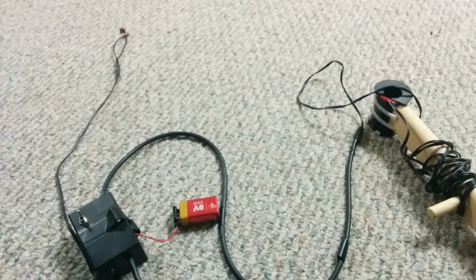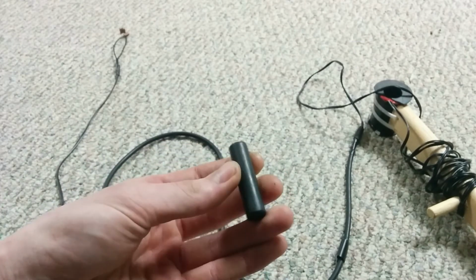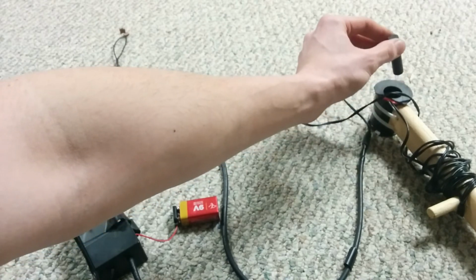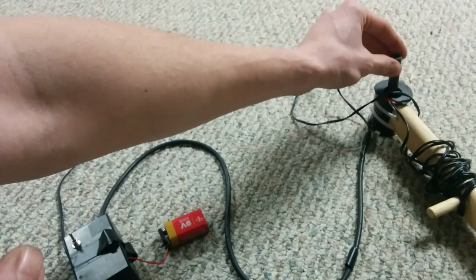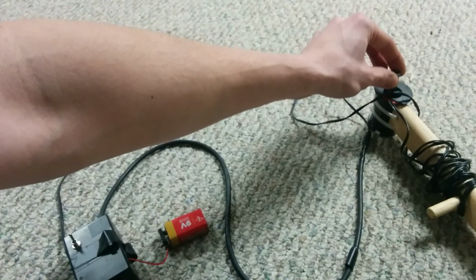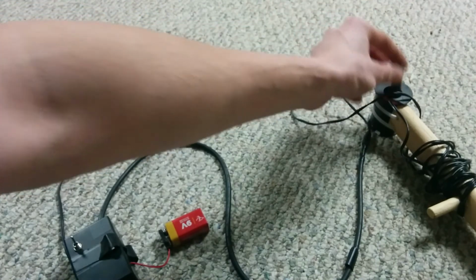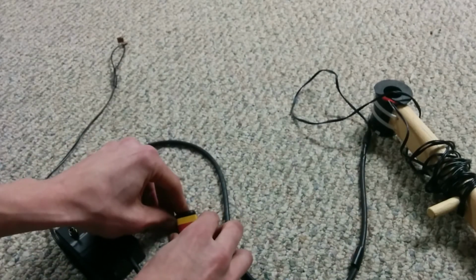I don't know, I had an idea. I have this piece of annealed iron here, and I think I can make a... You can hear me change this inductance and shift that resonance. And it doesn't go that far because it's root LC dependence. But actually, I got an idea here. So wait.